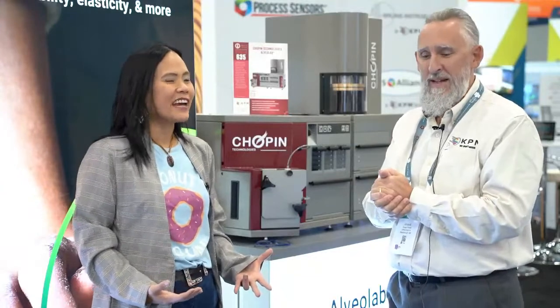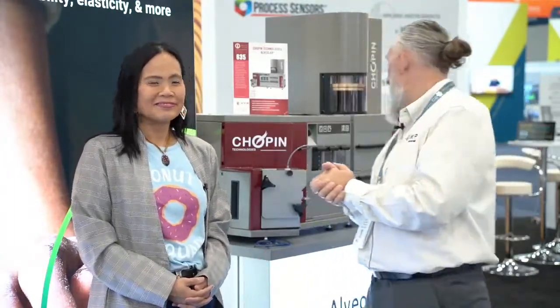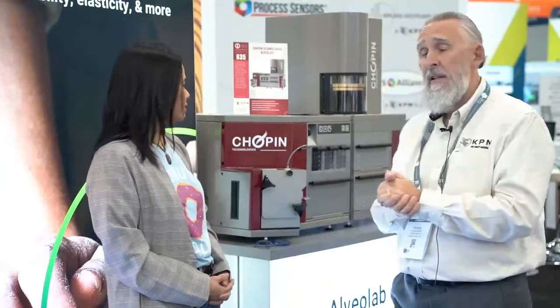So we stress the gluten first and then we let it relax, exactly — so that we can blow bubbles out of it. That's the idea. And this device or system has been on the market for quite some time.